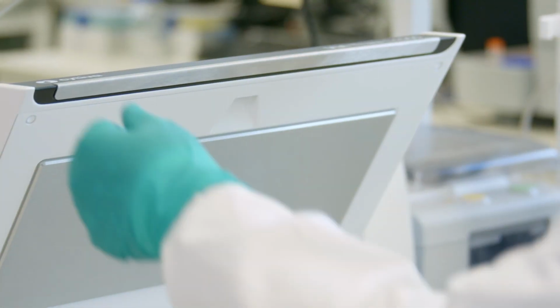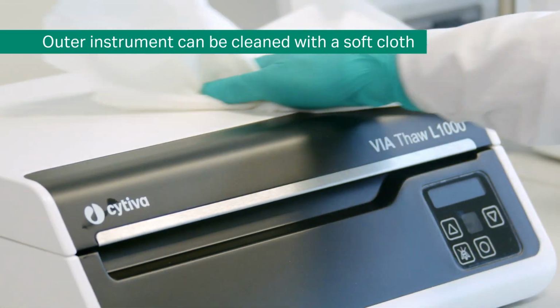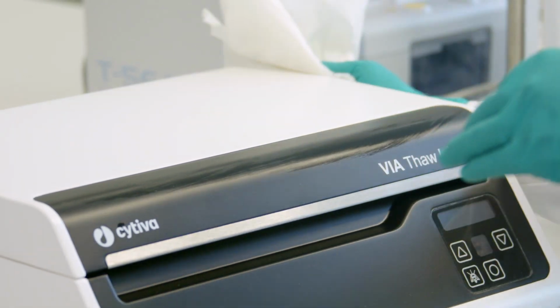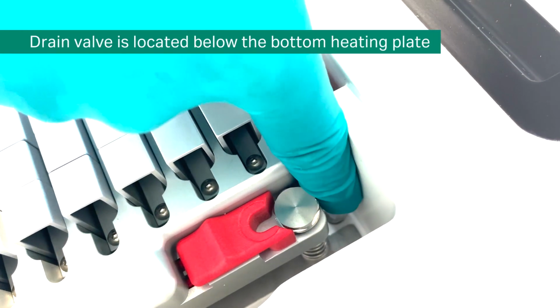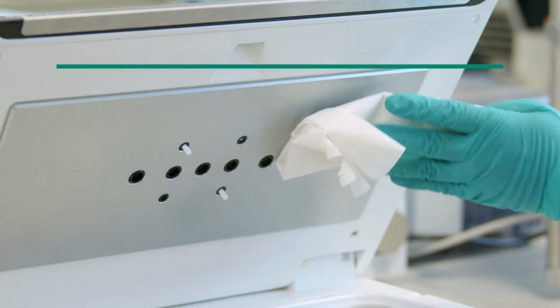If necessary, the outer parts of the instrument can be cleaned with a soft cloth, as described in the operating instructions. If any fluid leaks into the inner part of the instrument, a drain valve below the bottom heating plate allows you to extract all fluid and preserve the instrument's functionalities.